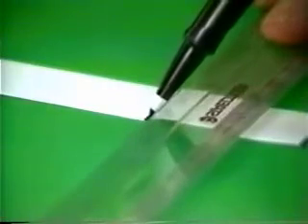A black line is drawn with a felt-tipped pen across the bottom of a strip of absorbent filter paper. The paper is suspended in the mixture of ethanol and water.